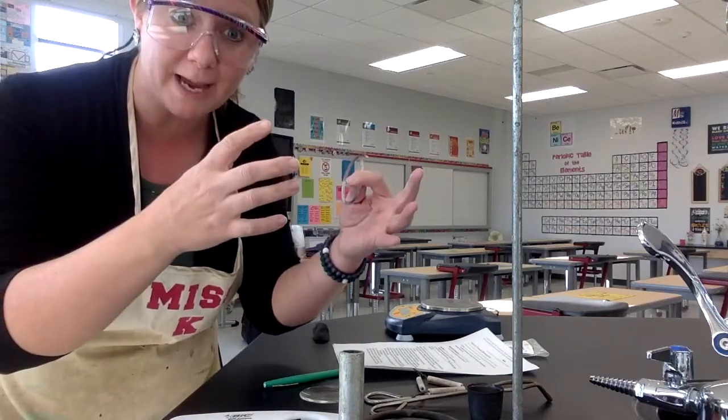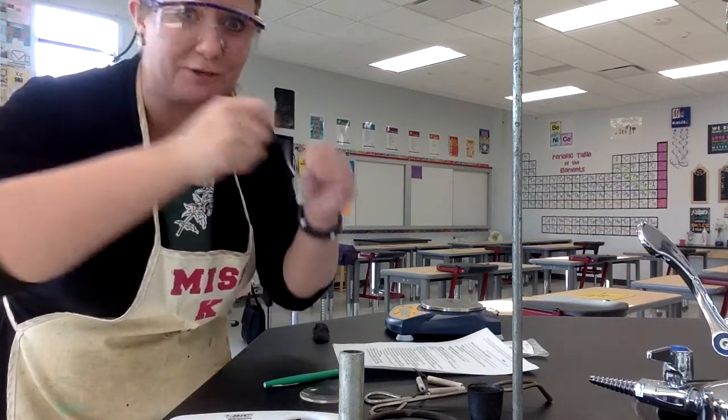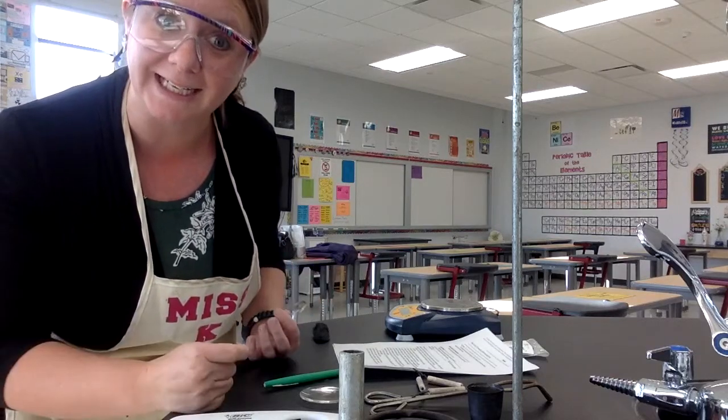I'm going to kind of be walking you through steps. I'm going to try to show you with my laptop camera some of the things that we're seeing. I don't know that I will be in the video the whole time, so if I pop out of it and you can just see my hands, that's fine. Just keep working as if you were my lab partner standing next to me.